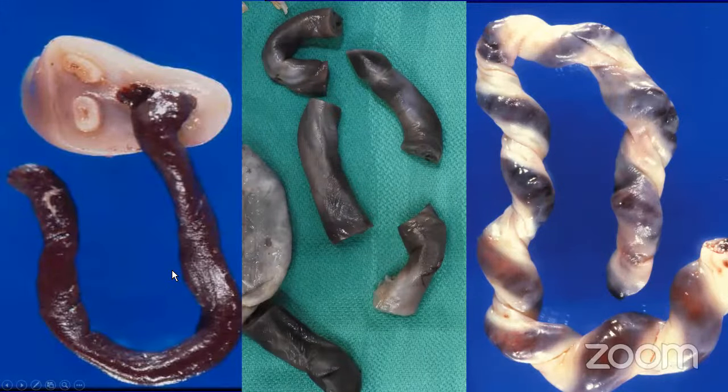Let me start on the top left-hand panel of this gross photo array of umbilical cord changes with fetal demise. Obviously this is a hypercoiled umbilical cord and it also has that ruddy-brown stillbirth discoloration. To the right is an umbilical cord that is a little hypercoiled at its cut end toward the fetal surface, but is flattened near the placental insertion — this was an umbilical cord wrapped tightly around the fetal leg, and that compression of the umbilical vessels led to fatal fetal vascular malperfusion. In the next right-hand panel, you see the cut surface of a placenta with markedly distended chorionic vessels. I tell trainees that if you can readily see the chorionic vessels on a glass slide, they are pathologically dilated. In these cross-sections of chorionic vessels, I can see the layer of an organizing clot.